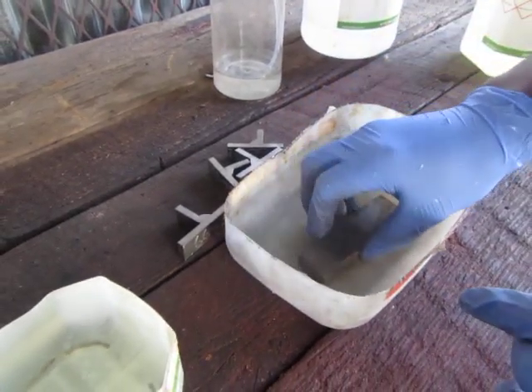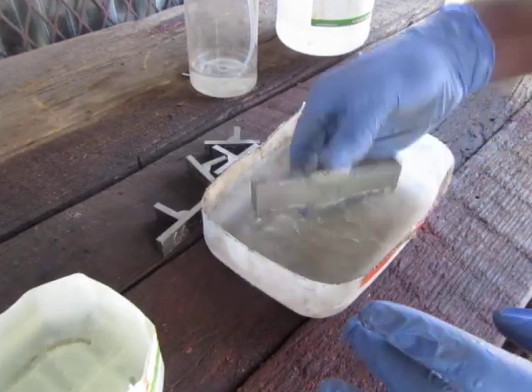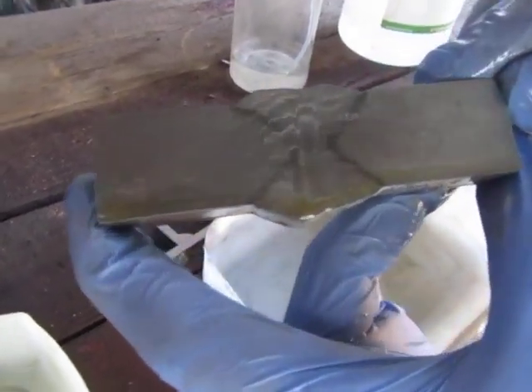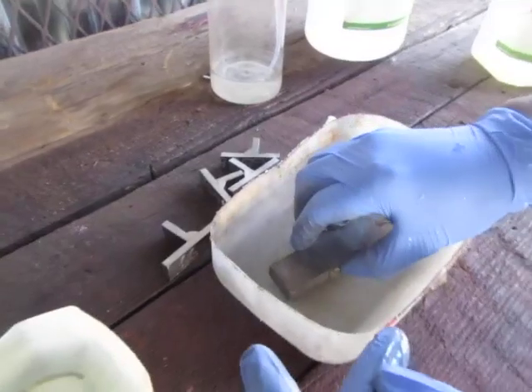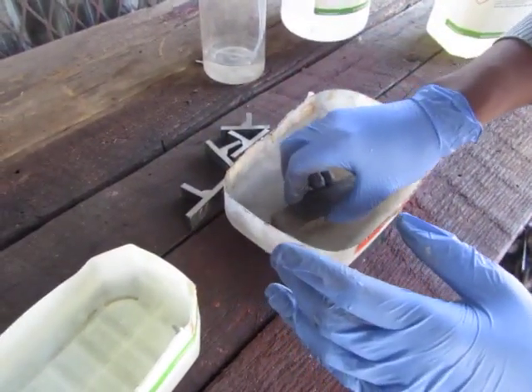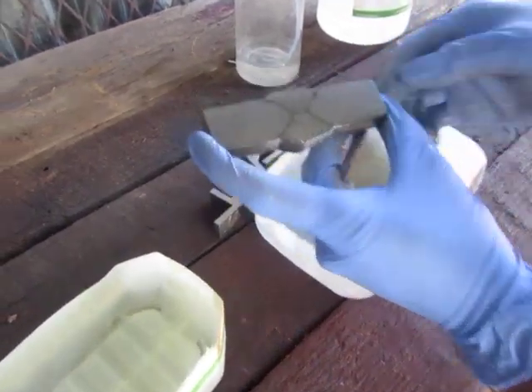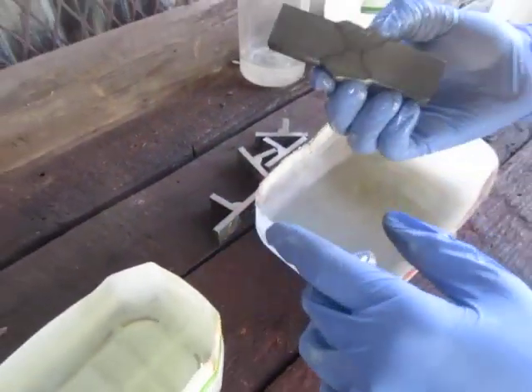This is so beautiful — look at the runs! Can you see the runs? It's so beautiful. I'll try to make it more clear. The more time you spend it in the acid mix, the more it reveals the runs. This is so beautiful.